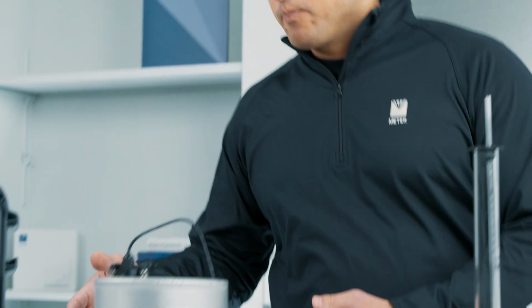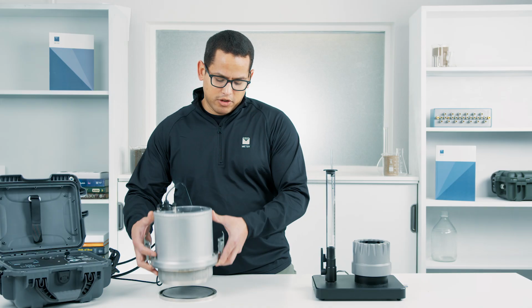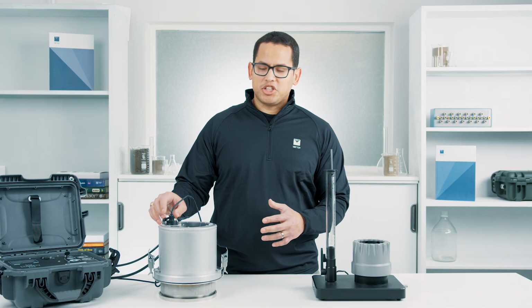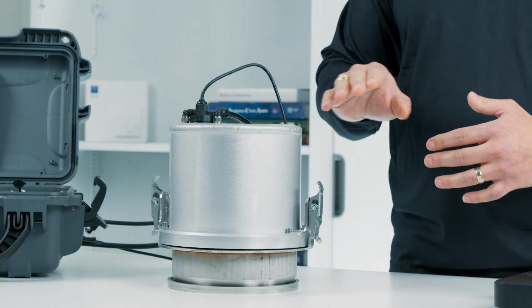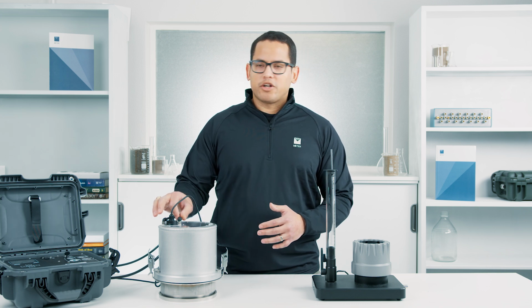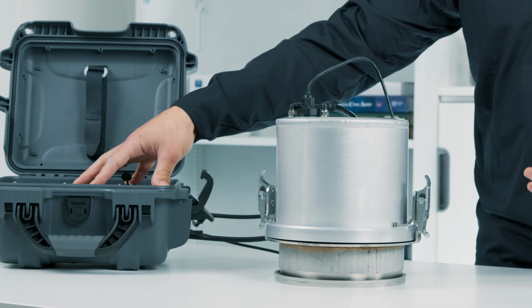Now, when we think about our field instrument, so here we have the SATURO, and again, what we're doing is inserting this ring into the ground, and we're gonna drive this into the ground. This is our upper chamber where we're doing some of the controlling from. So in this chamber, we have an air port and a water port, and then we have a level sensor. The level sensor is monitoring the water level, and we're trying to maintain a constant water level of 5 centimeters. And then we're adding water from this main control unit here. That is the brains of the device that actually does all of the calculations on board as well.